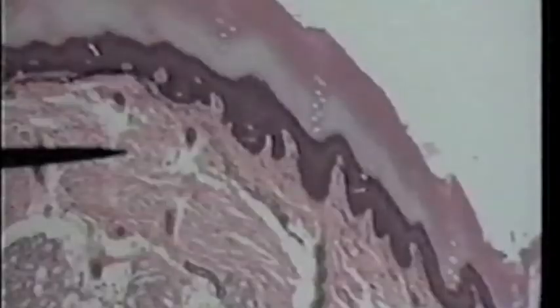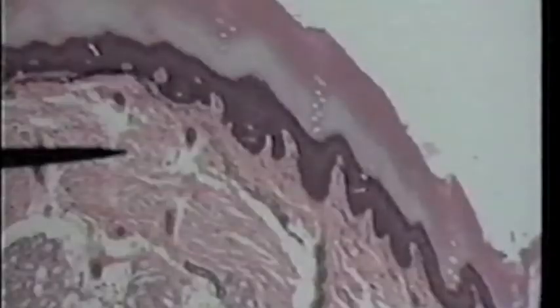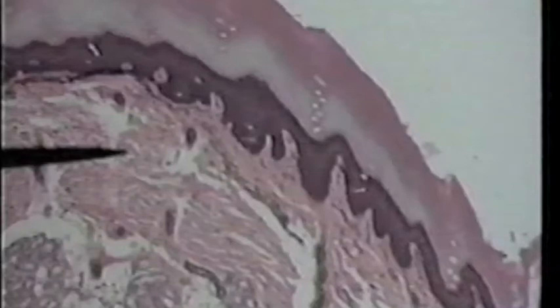We're looking at the skin again. The pointer is in the dermis. Superficial to that is the epidermis, and deep to that you can see a layer with adipose. That would be the subcutaneous tissue or hypodermis.